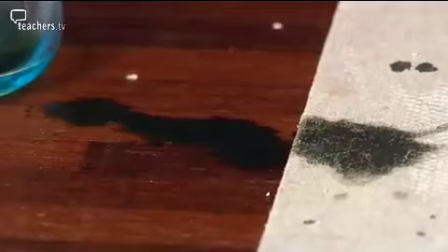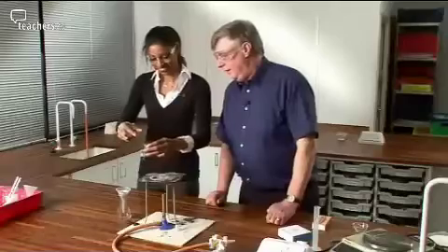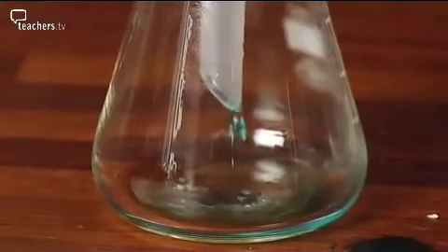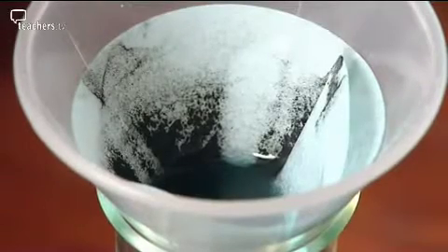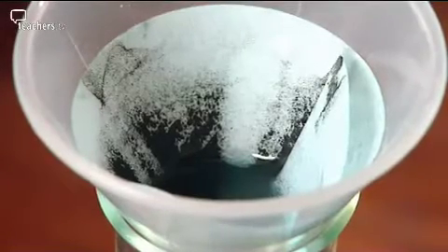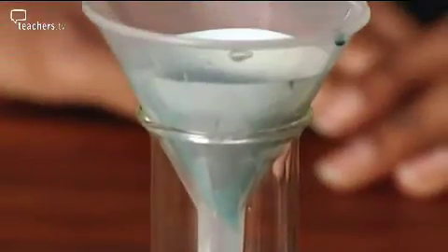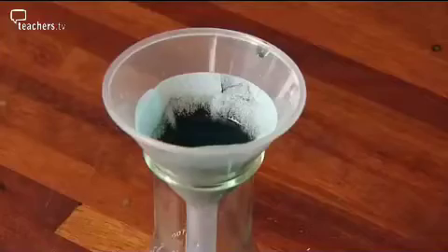Oh dear, what a mess. And now the blue solution's coming through, but all that solid goes into the filter paper and clogs all the pores in the paper, and the liquid can't find its way through. This filtration process is now taking far too long. So how would you avoid that? By not using so much solid in the first place.